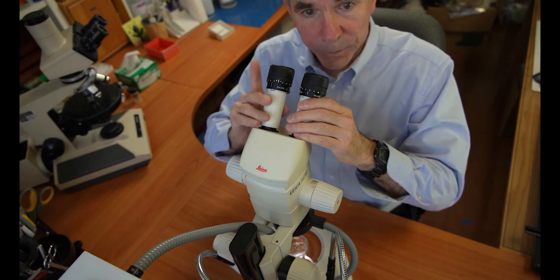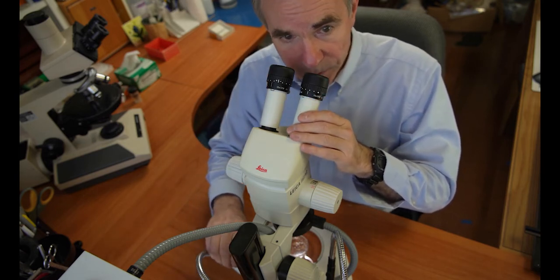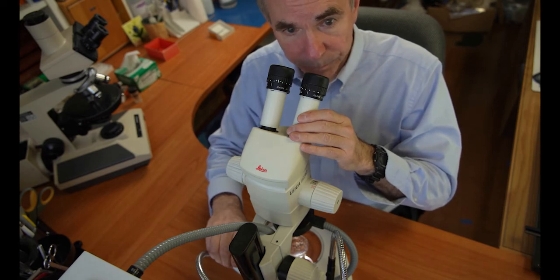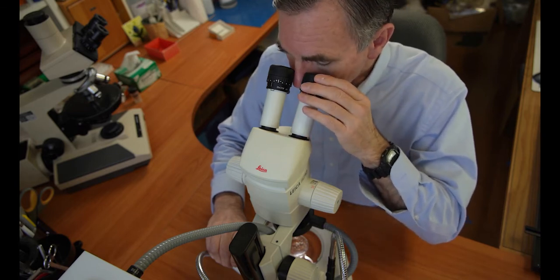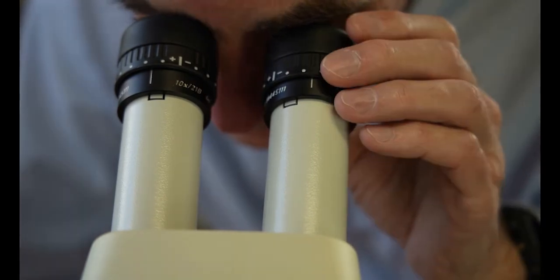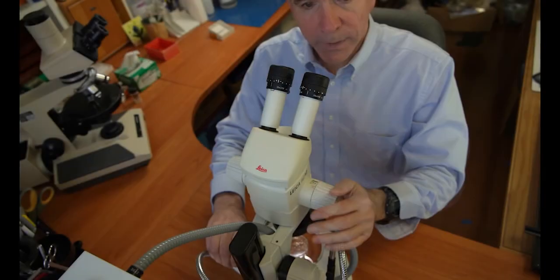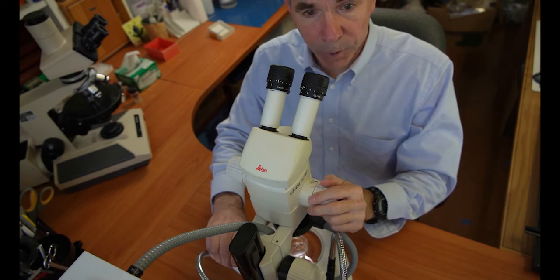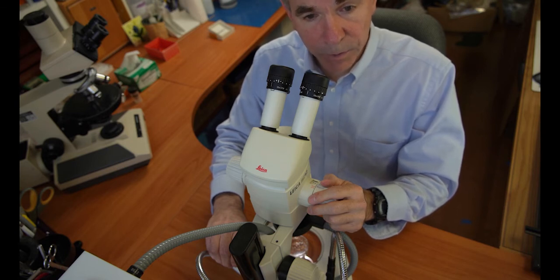While viewing the specimen with your right eye, use the focusing knob on the microscope to focus on the specimen or a portion of a specimen. Then, while looking at the same specimen or a portion of that specimen, use your left eye and adjust the ocular so that it is now focused using your left eye on that same specimen or portion of the specimen. Now your microscope is adjusted for your pupillary distance and each eye is focused on the specimen. This should mean that you're going to have less eye strain and hence less fatigue while using the microscope.